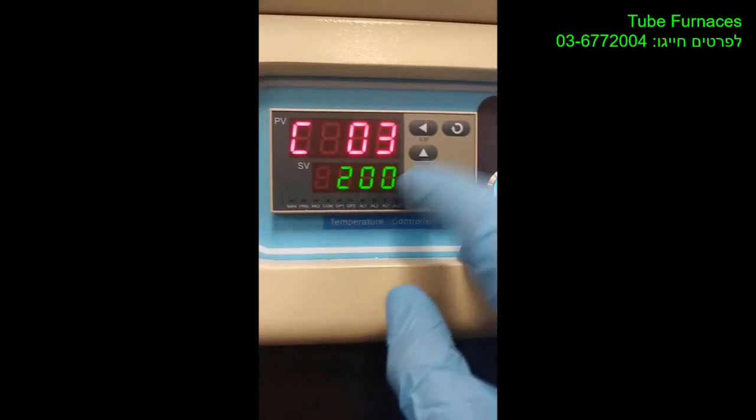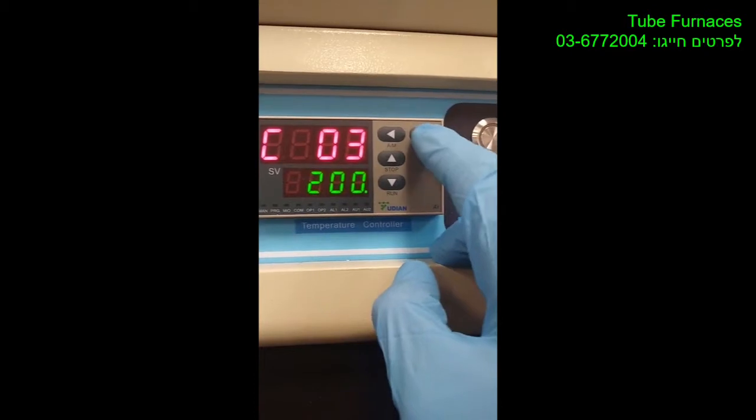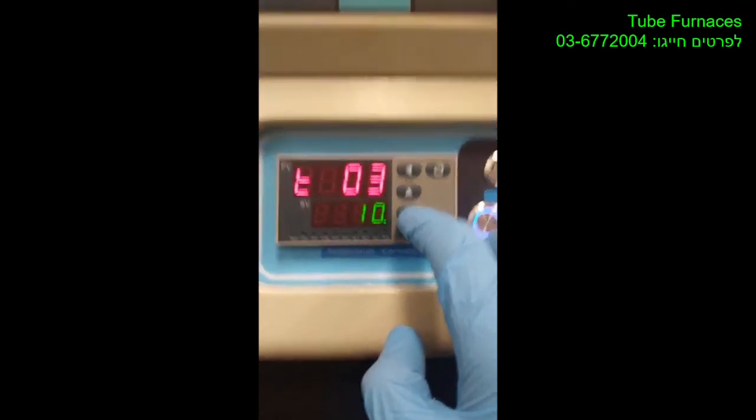Okay, and after that time, let's say you want another step, or you want it to cool down. So you put the time that you want.